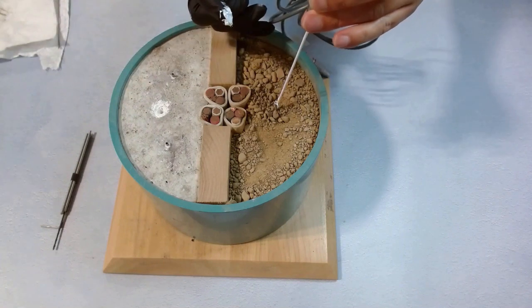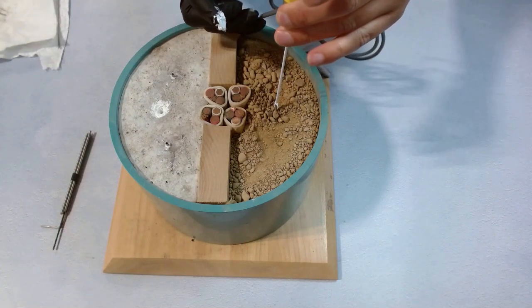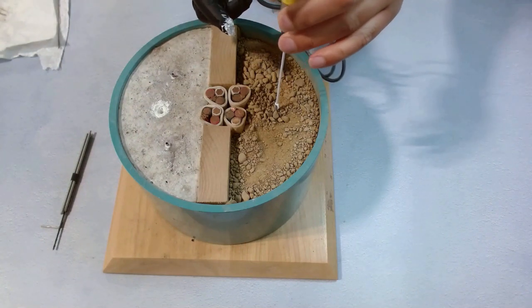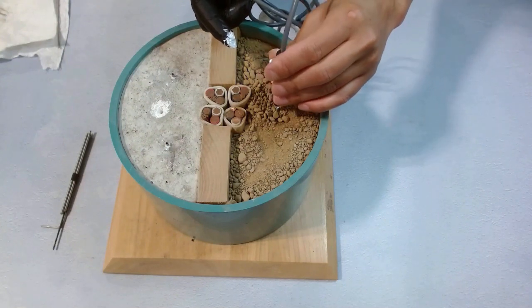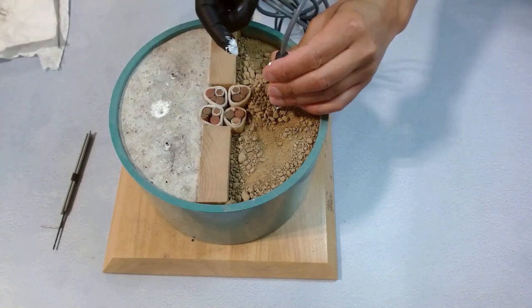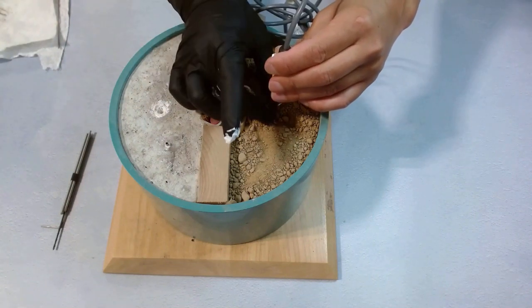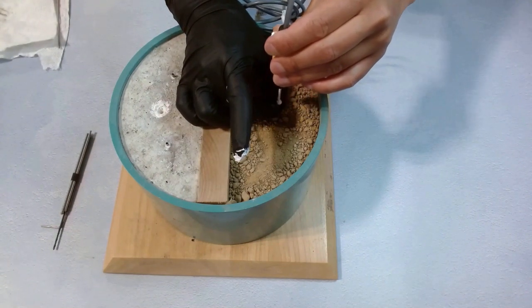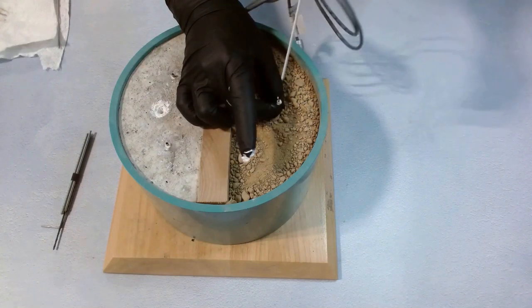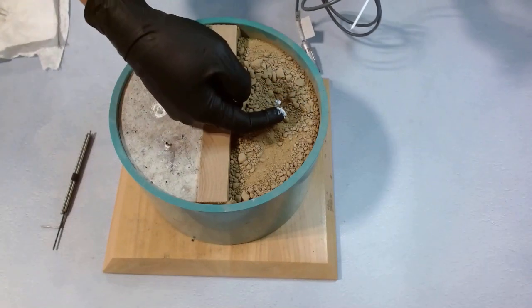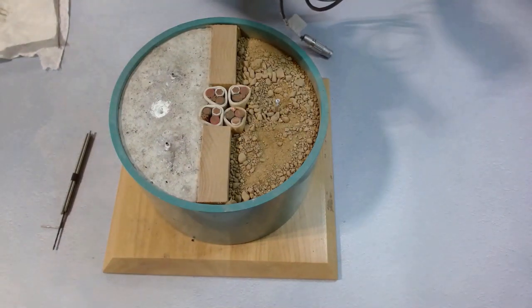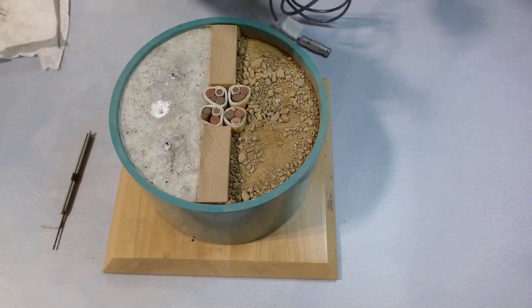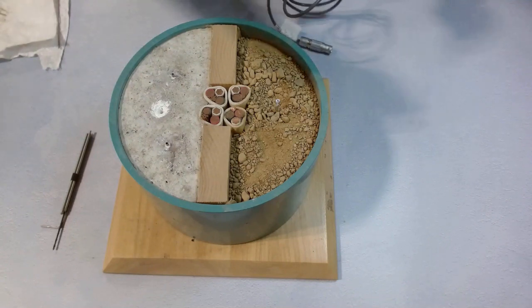Now we dip it in again, gently and slowly. Make sure it's straight and give a little twist at the bottom. We take it out again to see if it's still entirely covered with thermal paste. I recommend repeating this process a few times so all the space inside is filled up with thermal paste, so we can get good test results.